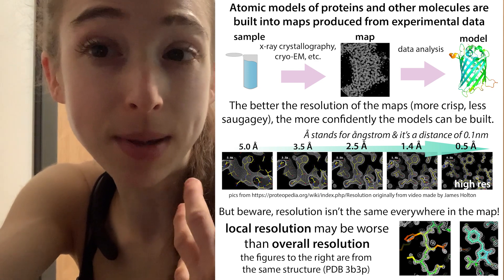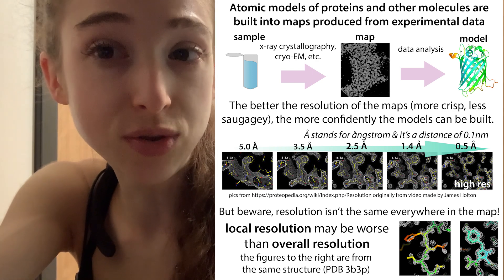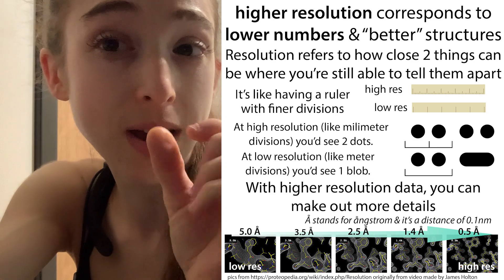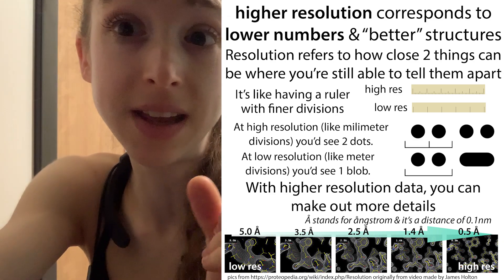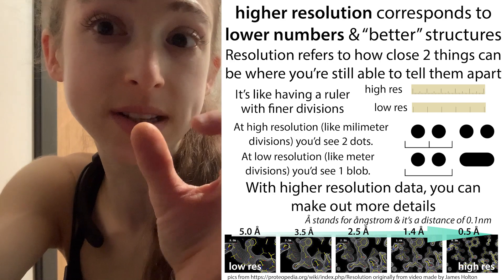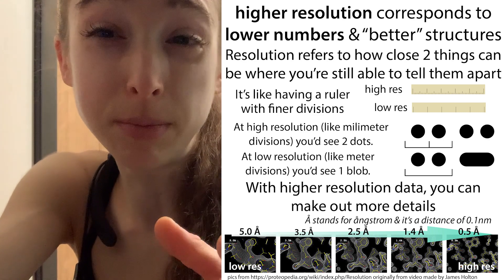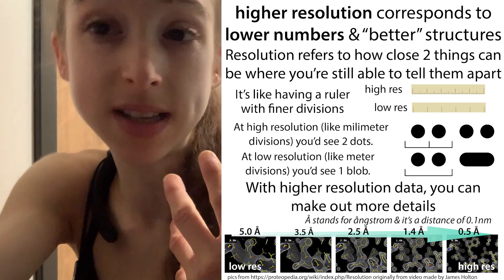The model must fit the map as best as possible. The crisper the map, the easier it is to do this — when we have a crisper map we talk about having a higher resolution. Resolution refers to how closely two things can be while still being distinguishable as separate. For example, can we tell that these carbons are actually separate carbons, or do we just see a sausage-like blob? A typical carbon-carbon bond is about 1.5 angstroms.